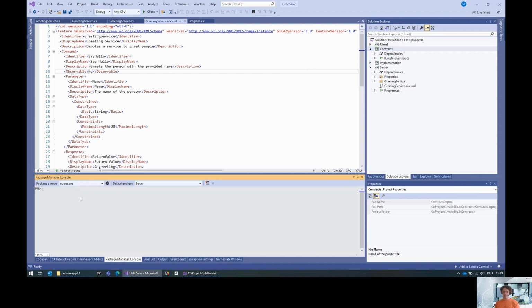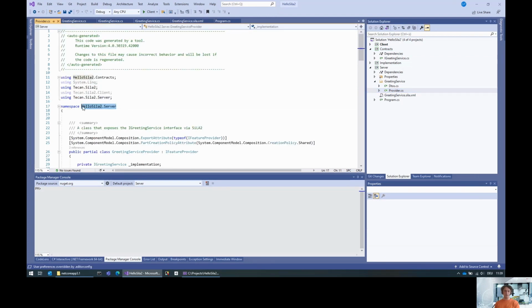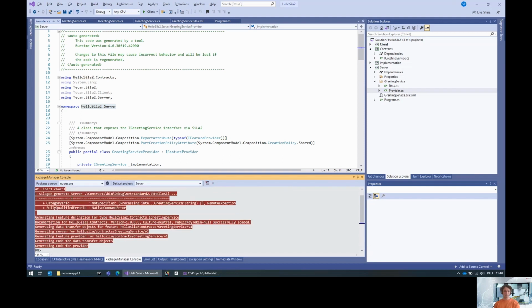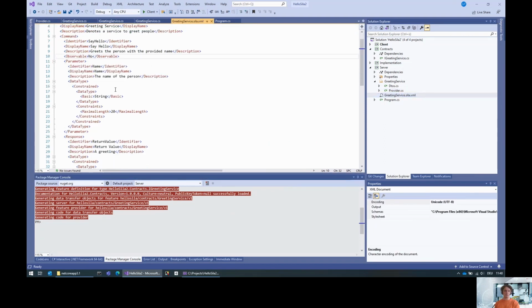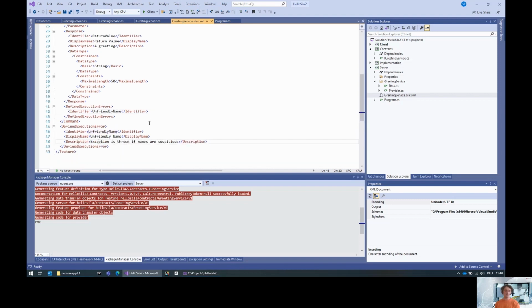Now that succeeded. Let me think about what namespace I used. I used hello SiLA2.server, and then we use SiLAgen again, generate server, and the first thing is the path to the build contracts, that's the contracts DLL. The second one was the path to the server CSProj. And we also specified the namespace. And there it is. Now if we take a look into the greeting service SiLA XML, we see a defined execution error, namely unfriendly name can happen. And this exception is thrown if names are suspicious.